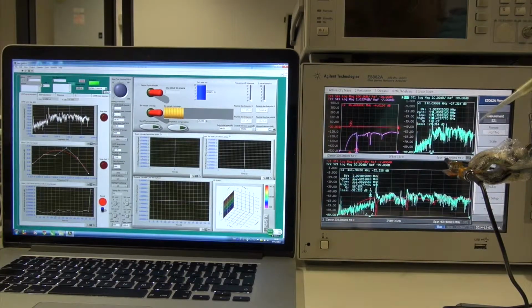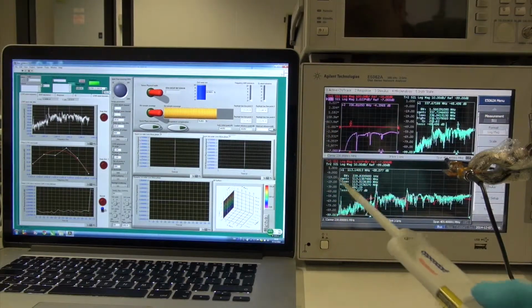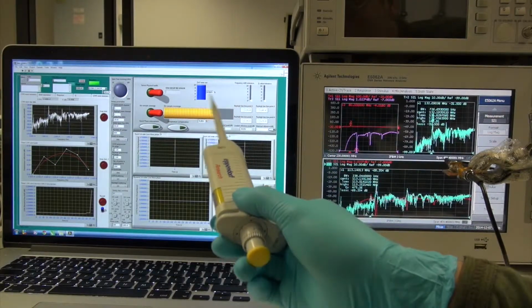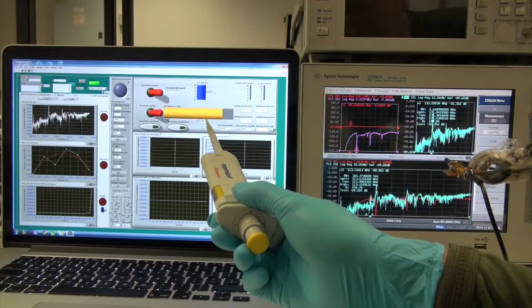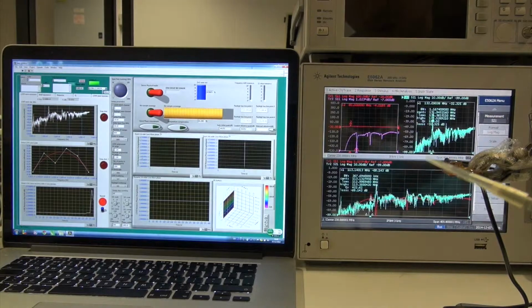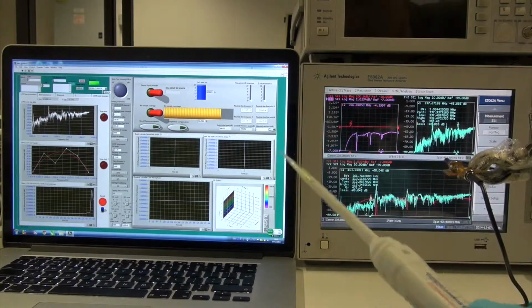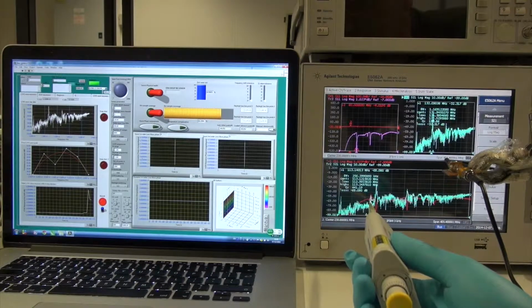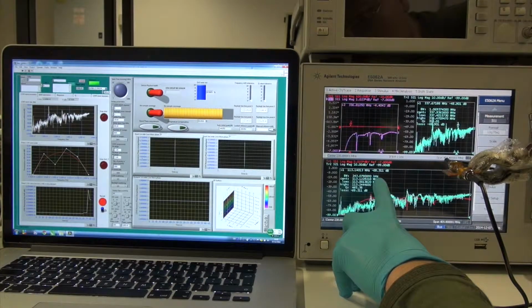So now if I increase the liquid to a big drop, you can see the Rayleigh wave resonance peak has totally disappeared, and it tells 76% has been occupied. No, it's 84% has been occupied. So it's almost fully occupied on the propagation area. From now on, the Rayleigh wave has disappeared. We can't use it as a measurement signal. But the Love wave, you can see it here. It's still very robust. The resonance peak is still very high.